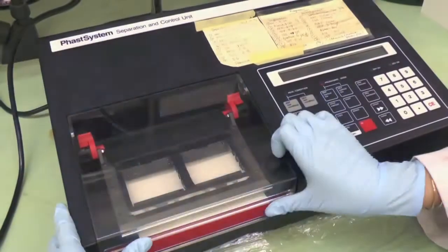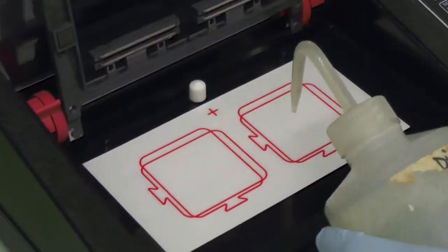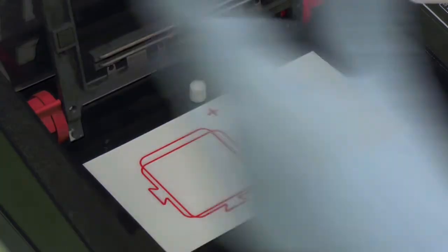Take the IEF 3-9 gels from the cold room. Clean the apparatus with dd water and wipe with Kim wipes.